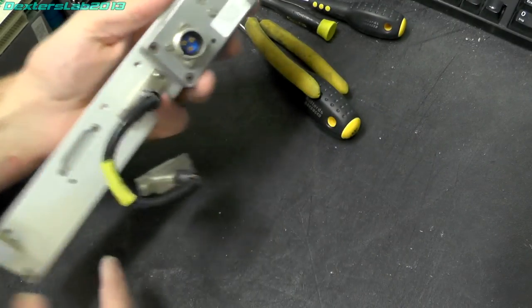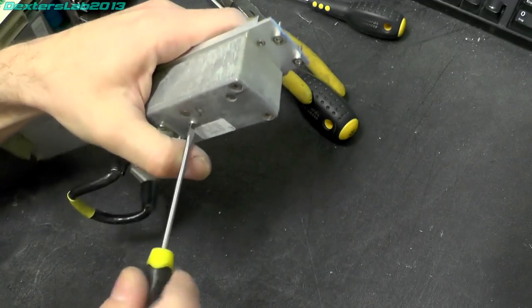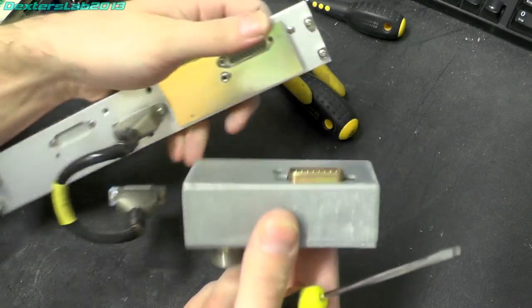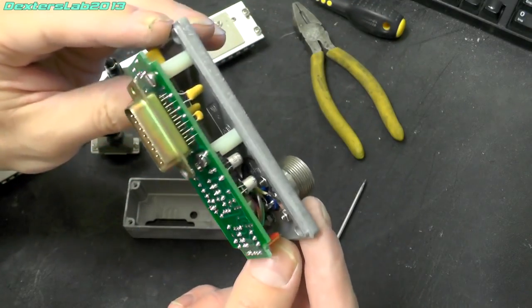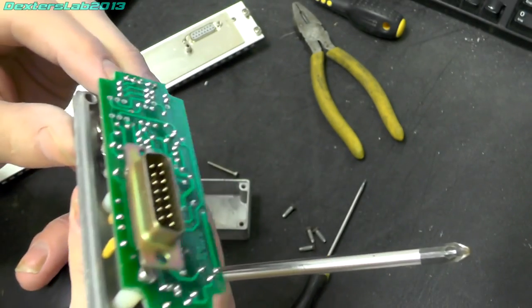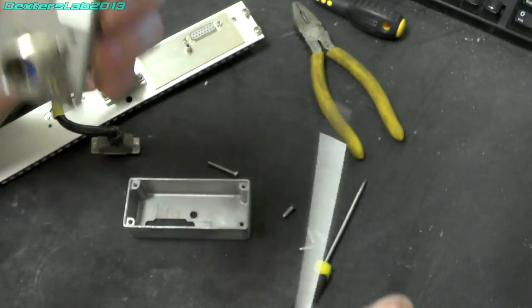Oh yes, not much on this one, but let's have a quick look at this interface box thing. Let's see whether it's similar to the other one. Okay, so it's similar, but it is different. There's a few bits and bobs in there.